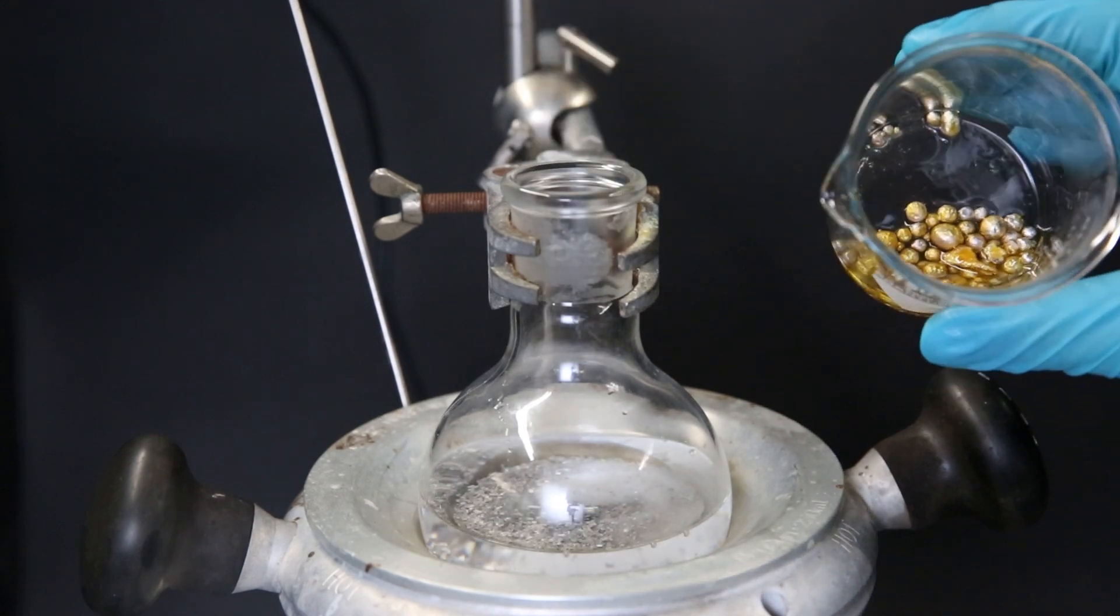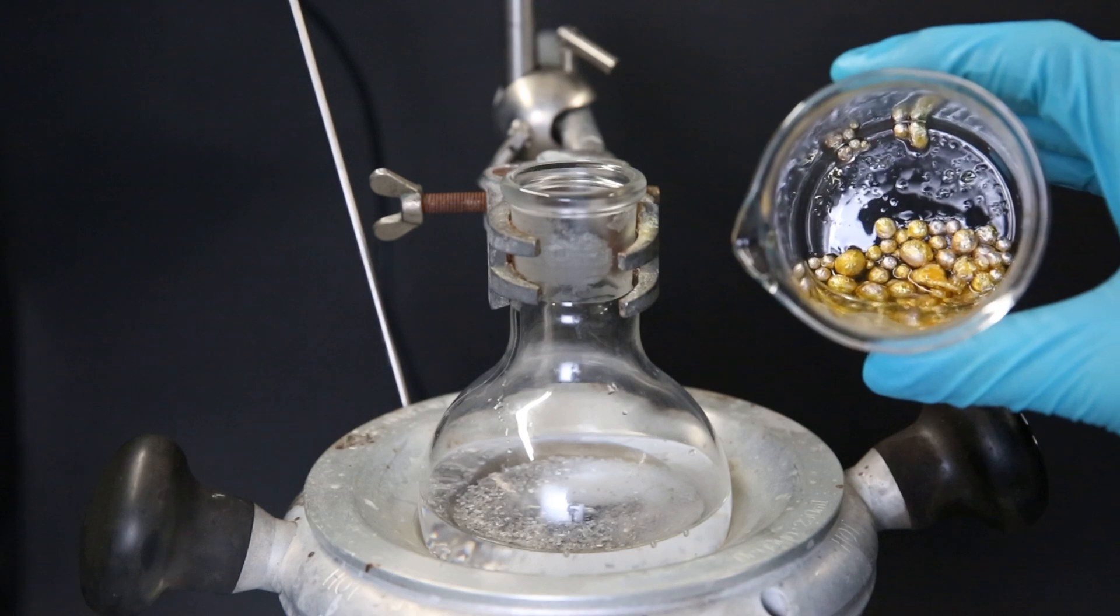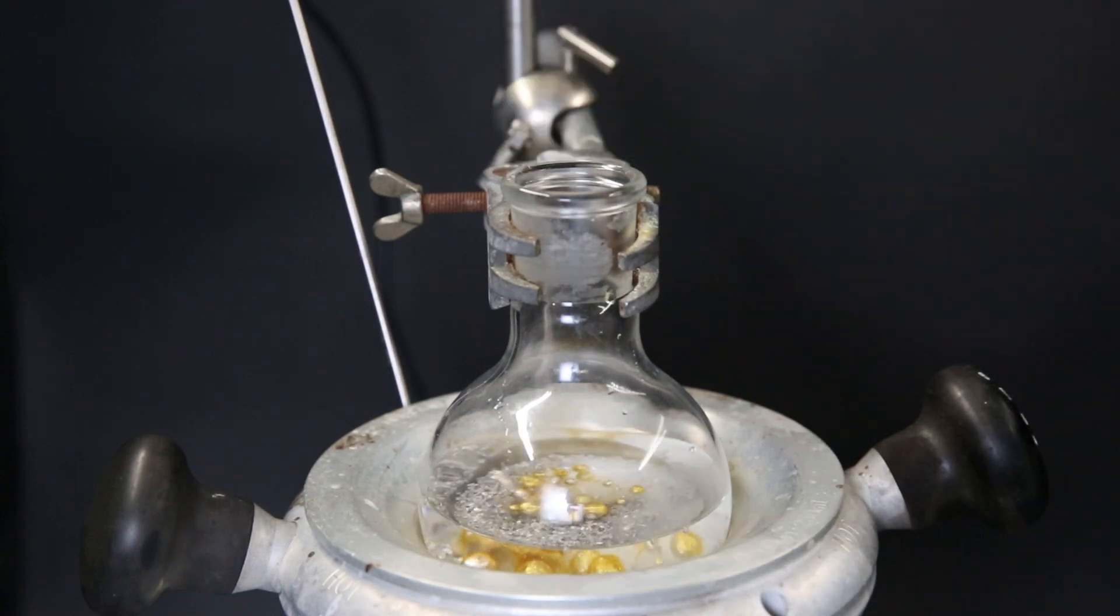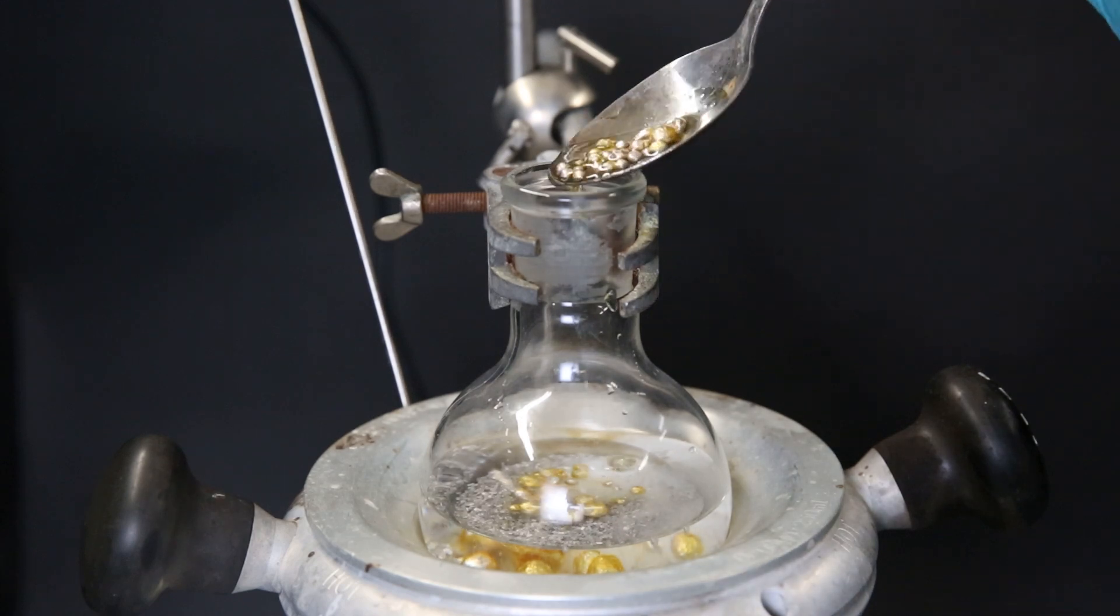Then I have some small bits of old sodium that I add in. This will help speed up the reaction but it is not mandatory. I don't know exactly how much it is but I'm gonna assume it's 2 to 3 grams.